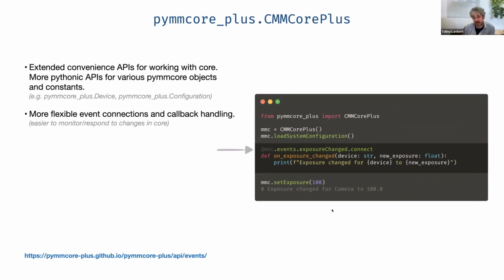PyMMCore itself does have a callback system, but it makes it very hard to connect multiple callbacks to certain events. And it's very easy to obliterate all your connections when you try to connect a new one. So this essentially makes one connection to the root callback system and then adds a layer of convenience that is much more like what you are likely to see in the Napari community or just any kind of Qt and/or Python-based event run loop. So that's that.